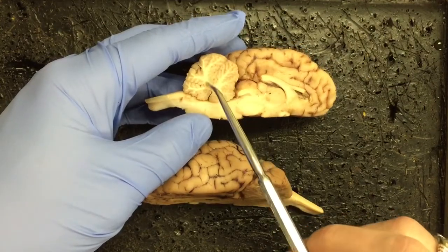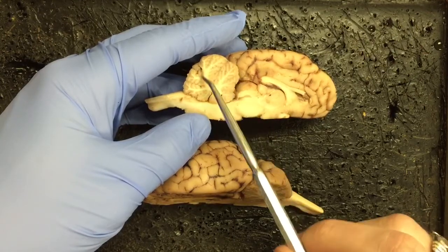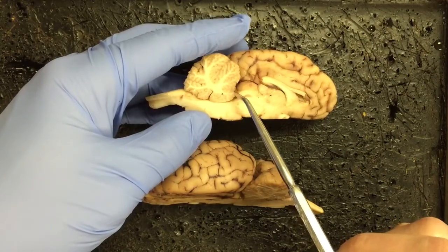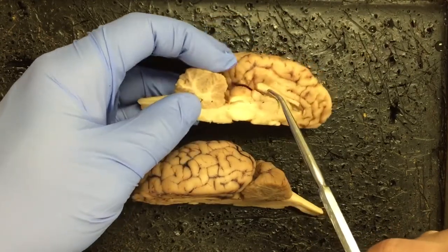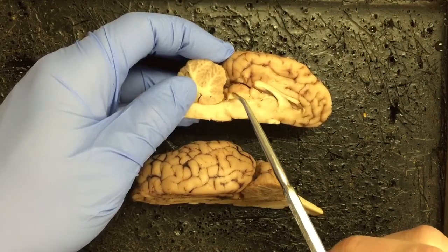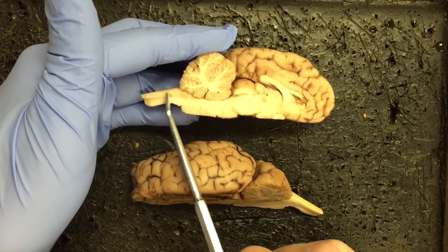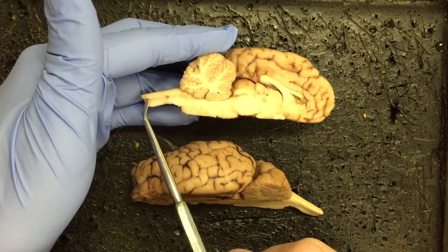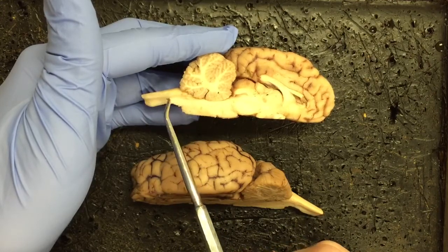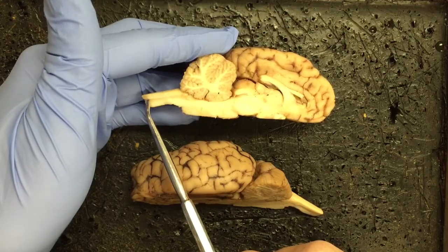You'll notice that it has white fibers in the middle for white matter and gray matter on the outside. It actually looks like a tree. It's actually called the arbor vitae, the tree of life. We have the superior colliculus, which we saw earlier. This is its side view, and this is the inferior colliculus right there. The spinal cord extends posterior to the cerebellum. The central canal is this dark region that goes through the center that continues the flow of cerebral spinal fluid as it goes from the 4th ventricle down into the spinal cord.